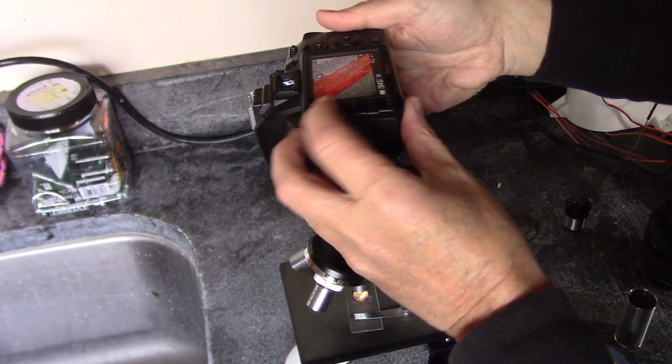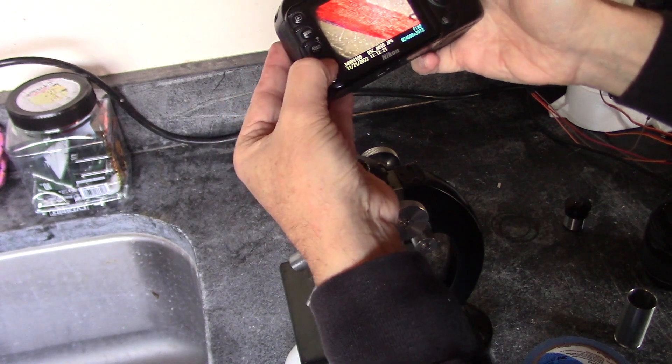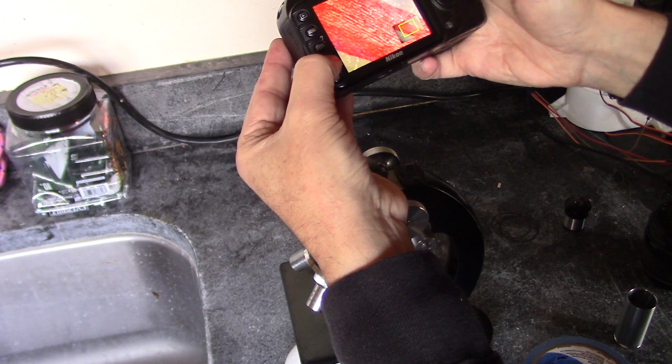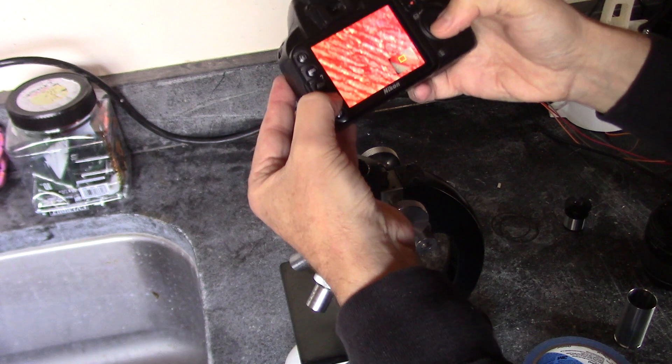Okay, and let's zoom in and take a look. Okay, and you can look around, all right, so you can see the individual cells.